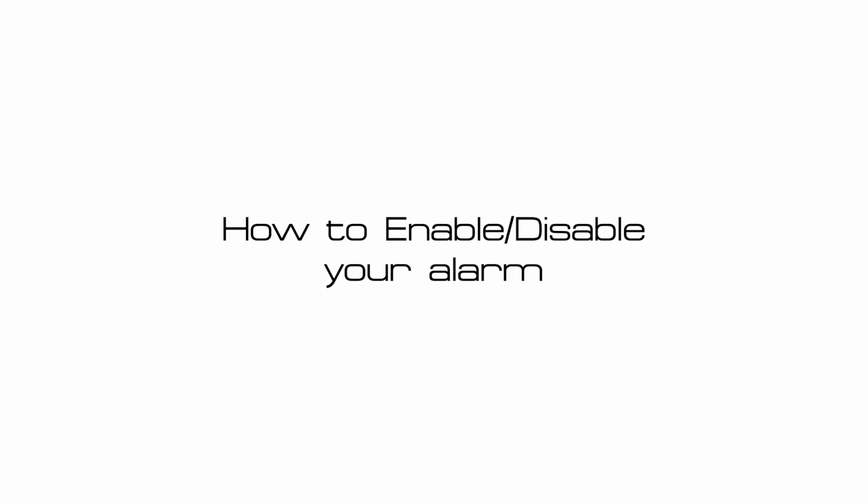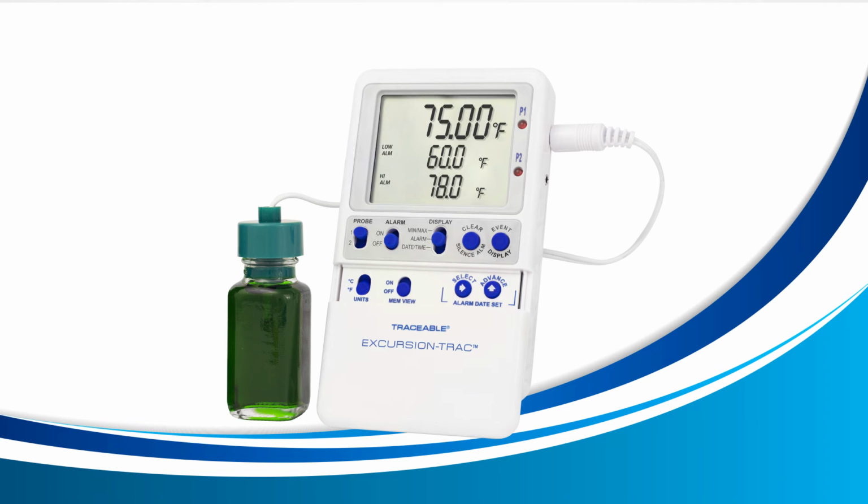How to enable and disable your alarm. To enable or disable your alarm, we're going to use the alarm switch located towards the left. If you'd like to enable your alarm, be sure to align the alarm switch with the word on. If you'd like to disable your alarm, be sure to move the switch down to off. Keep in mind that when you enable or disable your alarm, both probes will be affected.